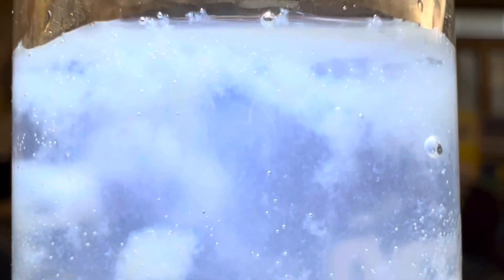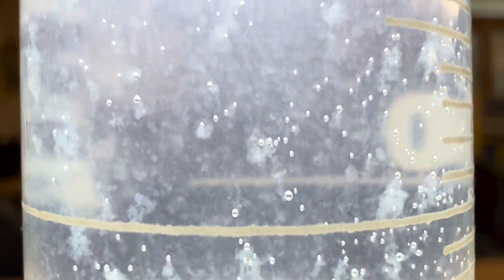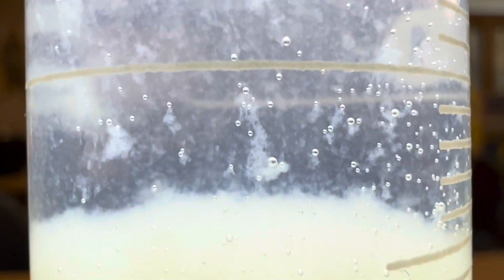Here's a closer look at that zinc sulfide precipitate, that white insoluble solid, and this beautiful precipitation reaction. In the light, you can see how beautiful it is.